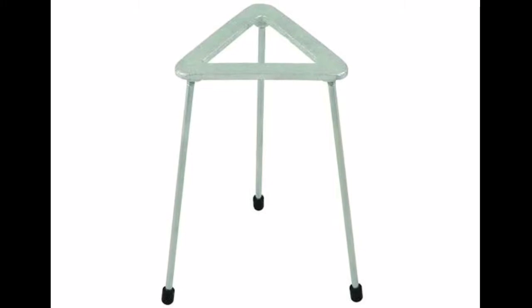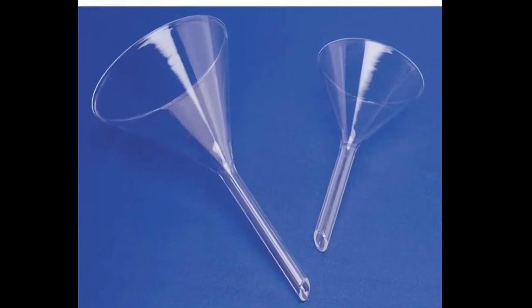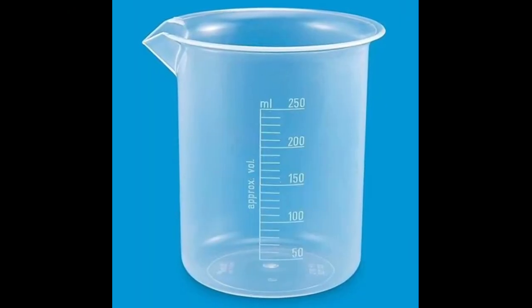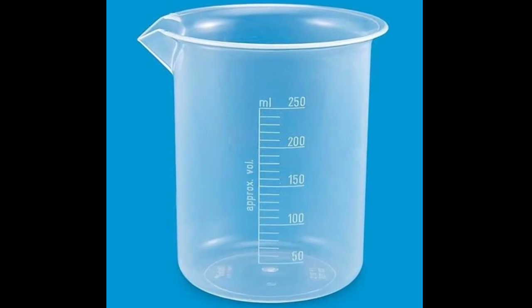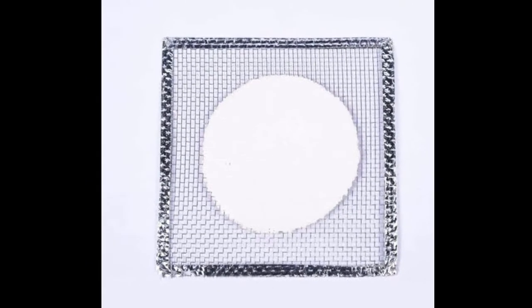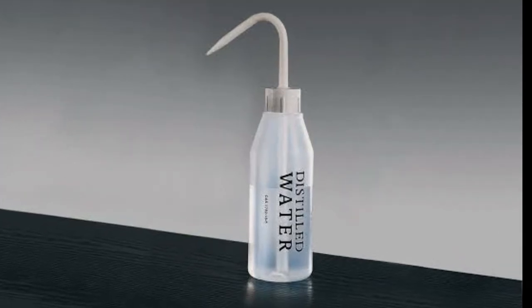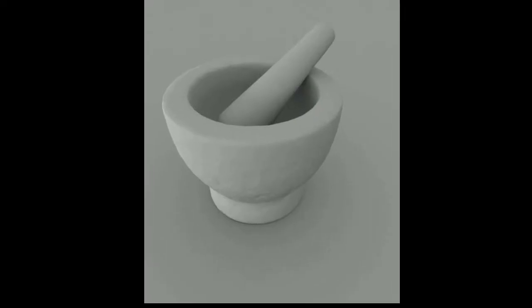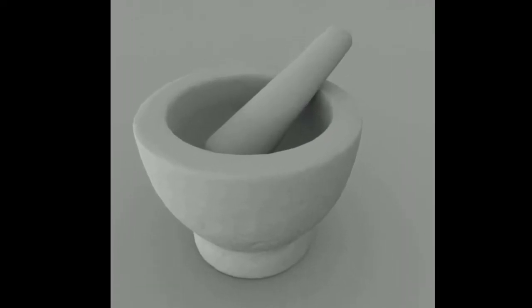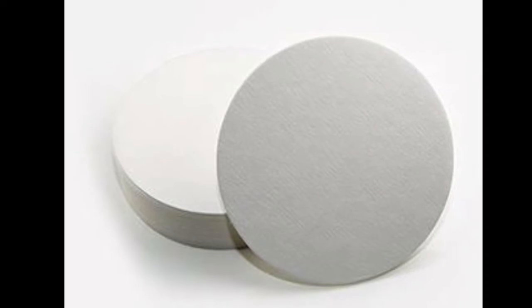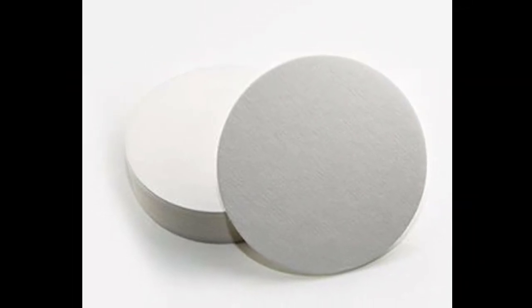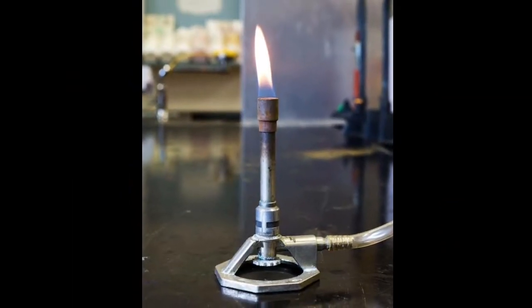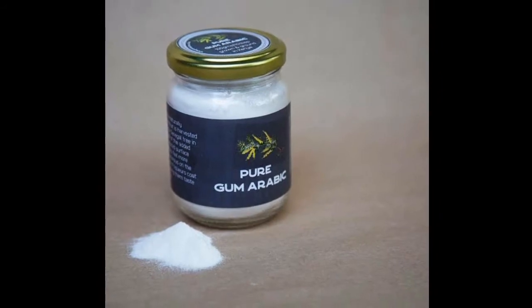Tripod stand, funnel, beaker of about 50 to 250 ml, wire gauze, distilled water, pestle and mortar, glass rod, filter paper, burner, and 500 mg gum.